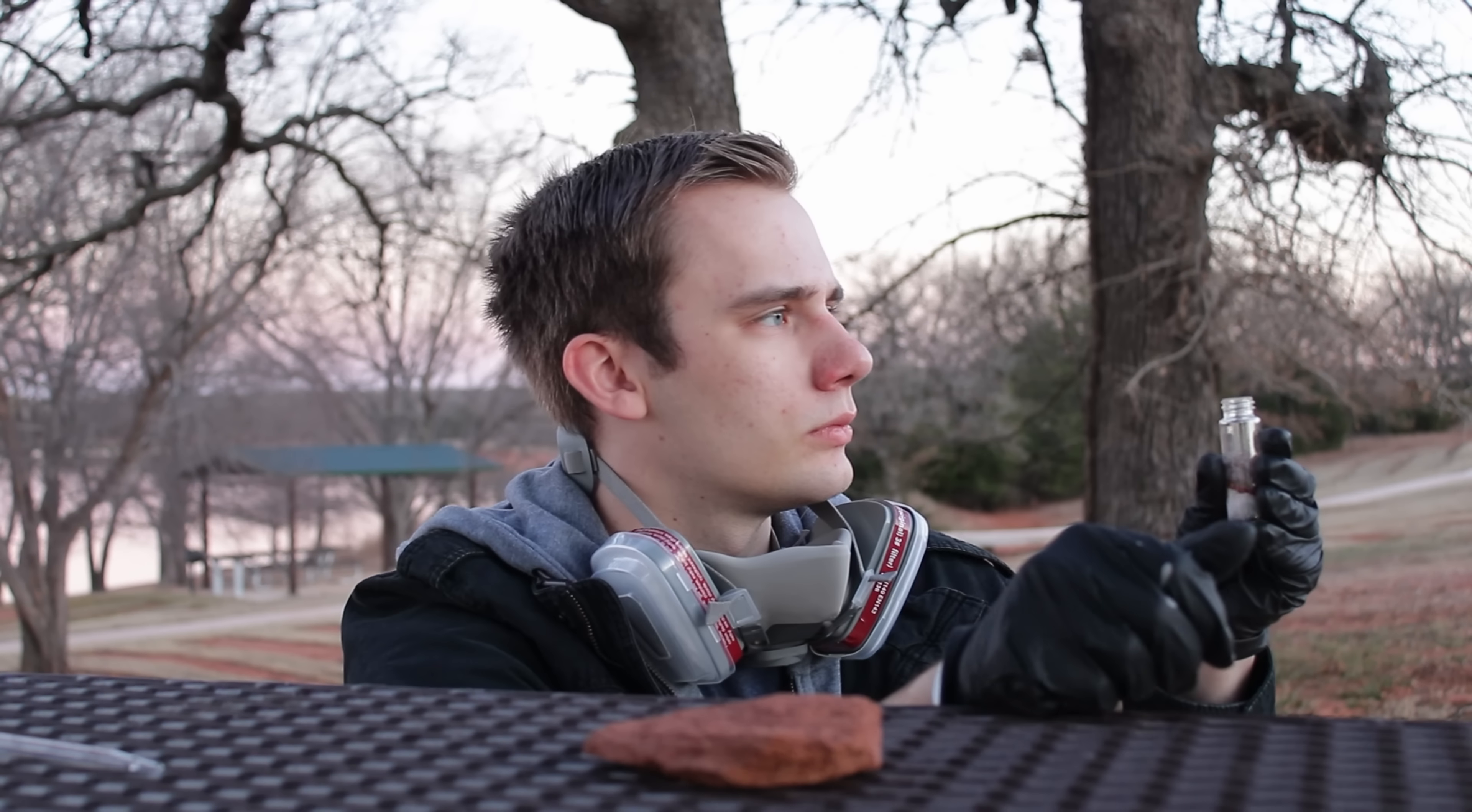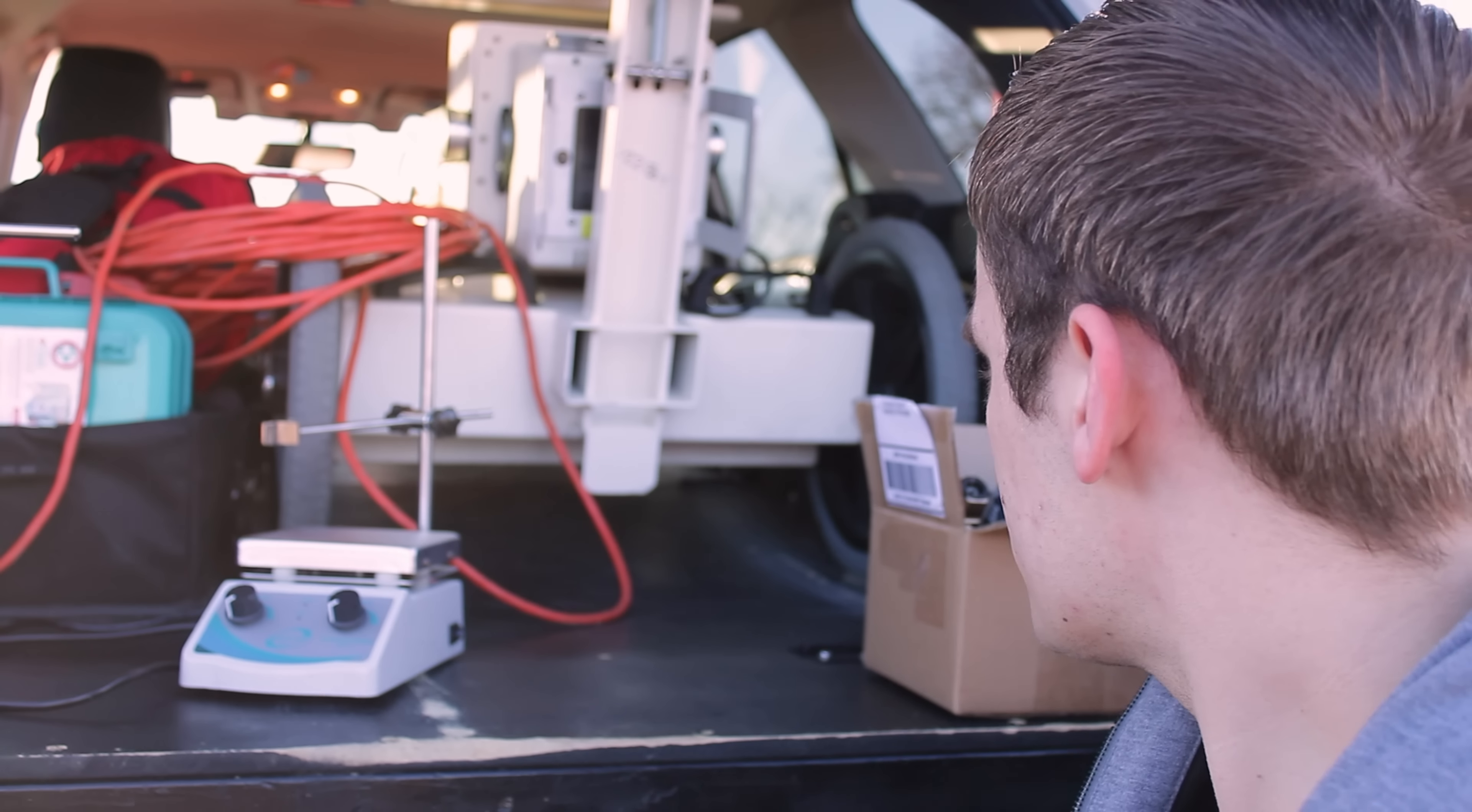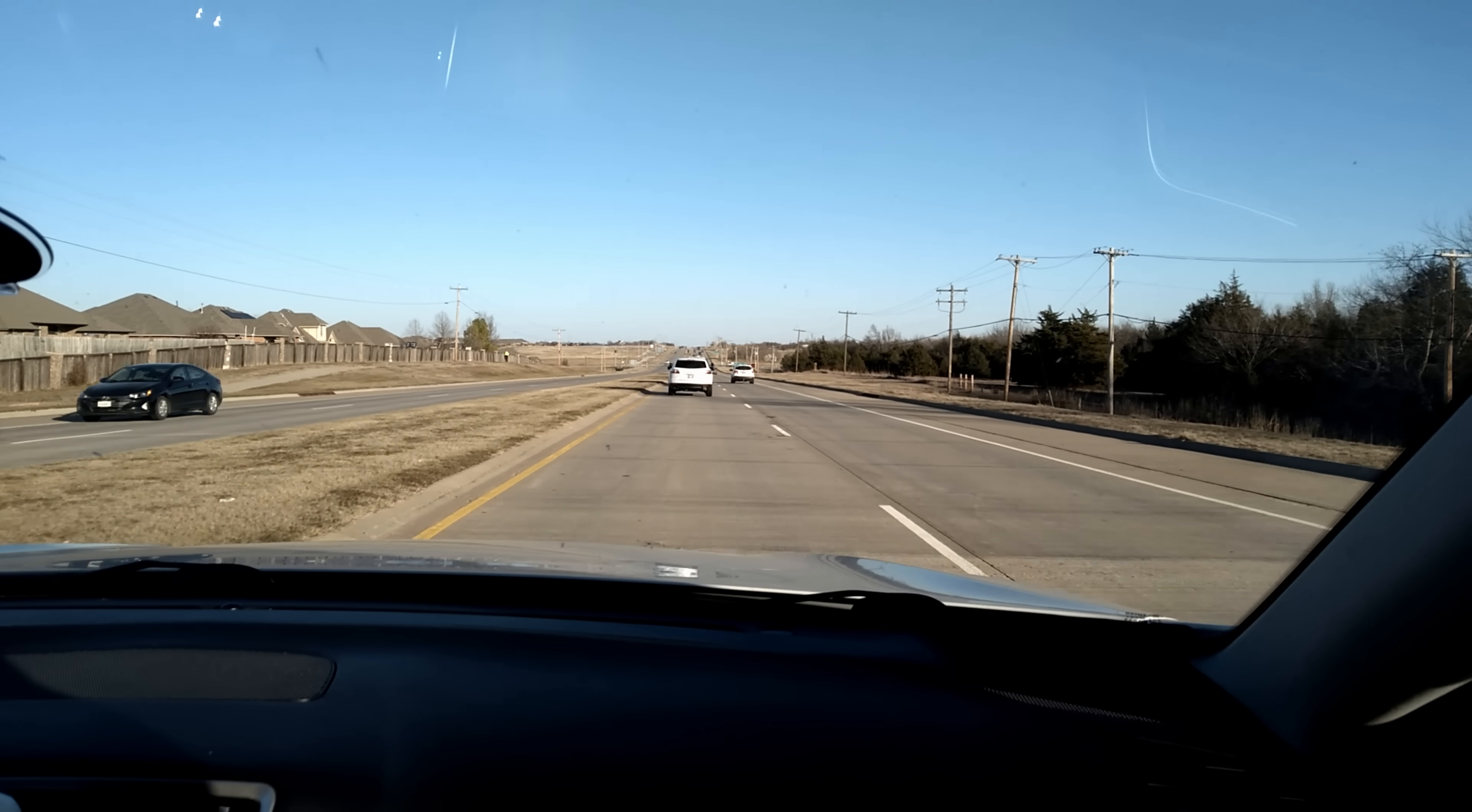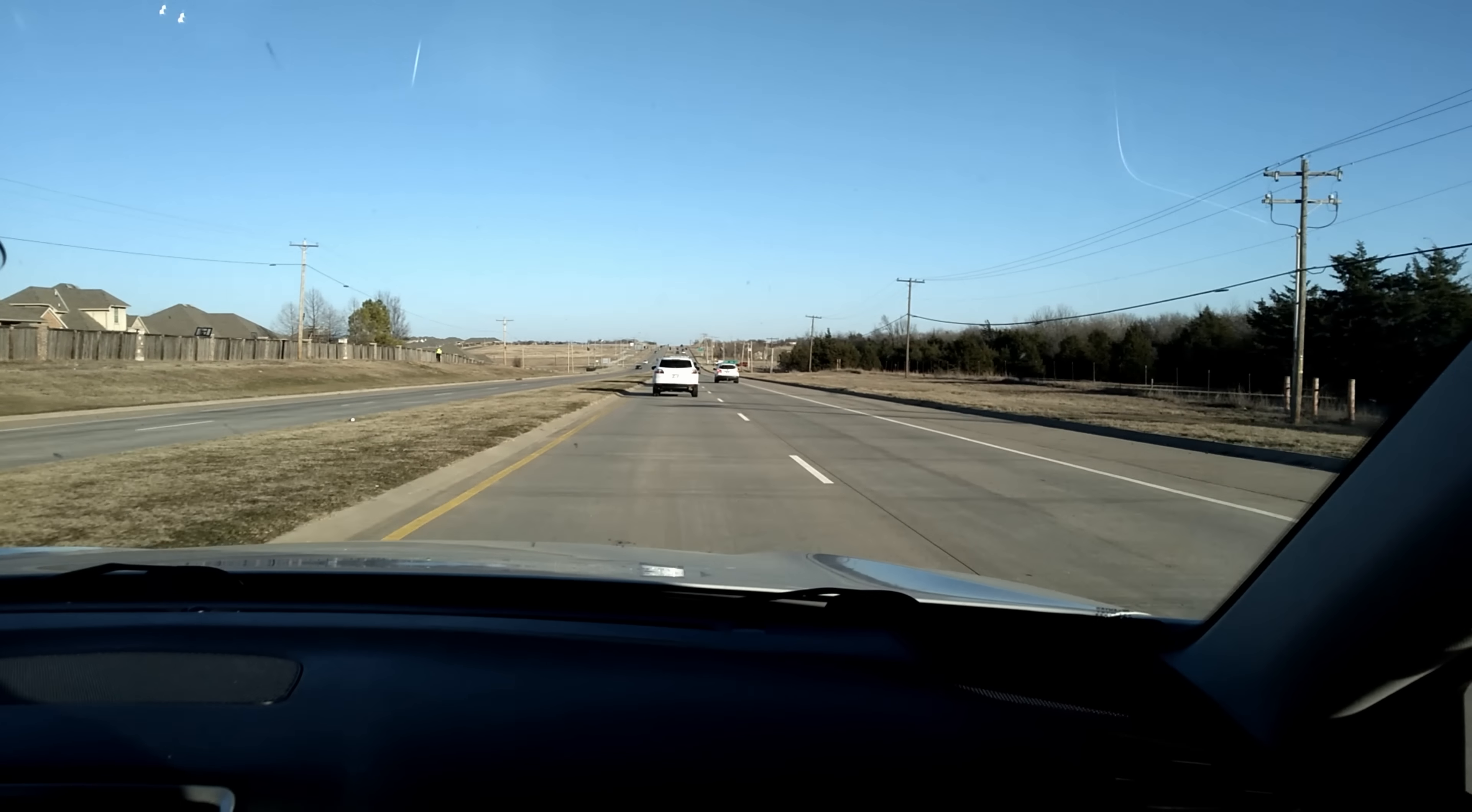Now, theories are great and all, but nothing quite compares to real life experience. So I weighed out each of my reagents, packed everything up, and headed to an abandoned campground to set my organoselenium nightmares free.